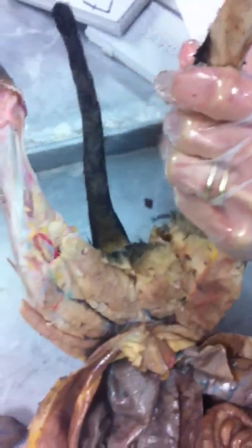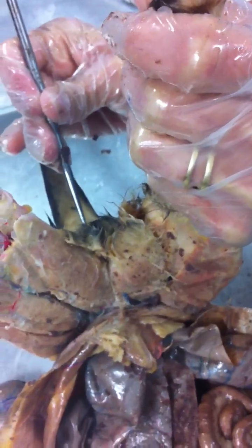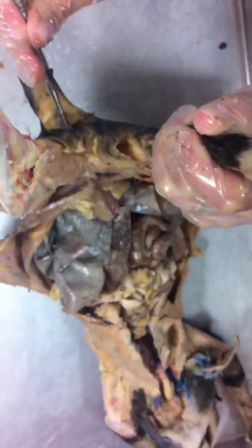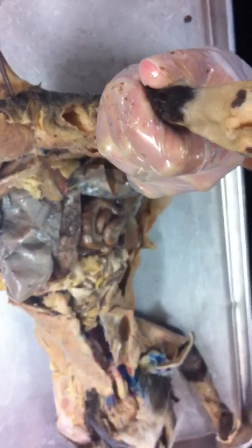All right. Looking at the rear end. Anus. Good job. A big hole underneath the tail is the anus. And then underneath the anus, there is another opening right here called the urogenital aperture. Let's break it down. Urogenital. What's happening through this opening here? Urination and reproduction. Now, I am not saying that the urethra and the vagina are the same thing. What I'm saying is that they empty into this common area, into this common opening.